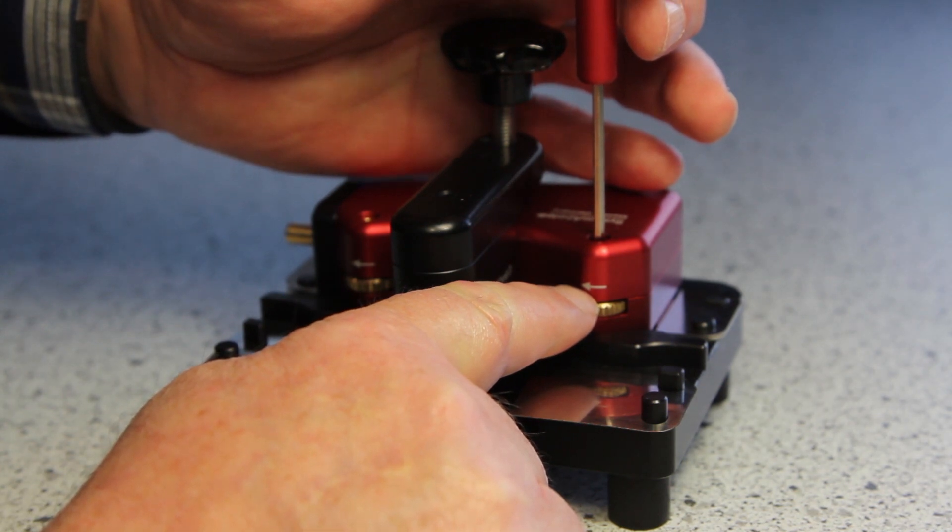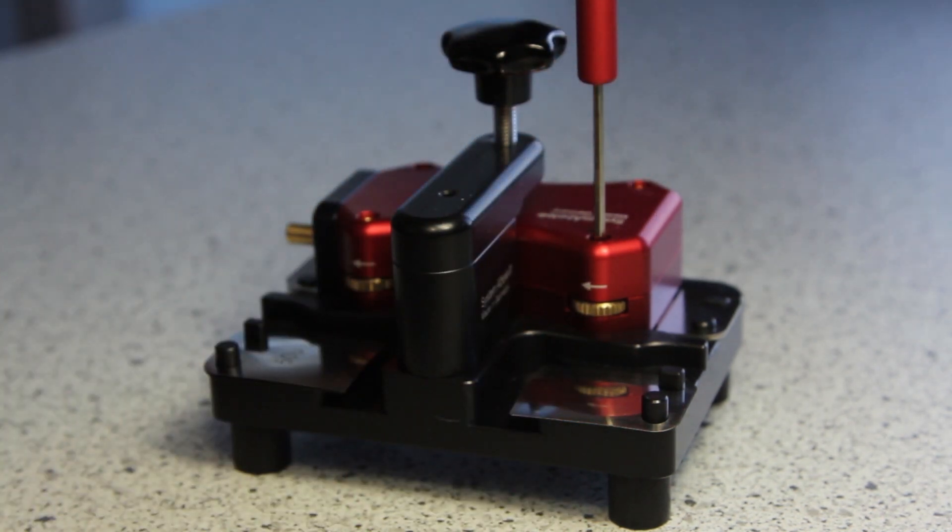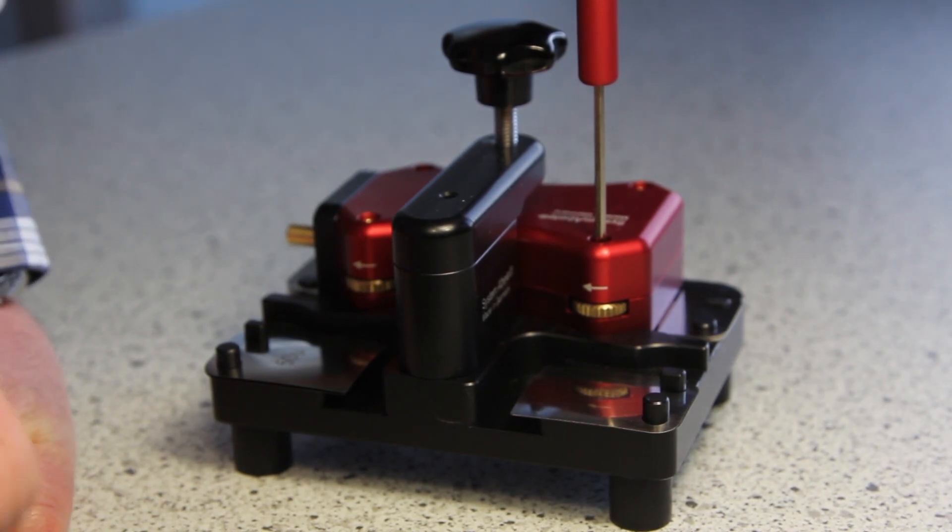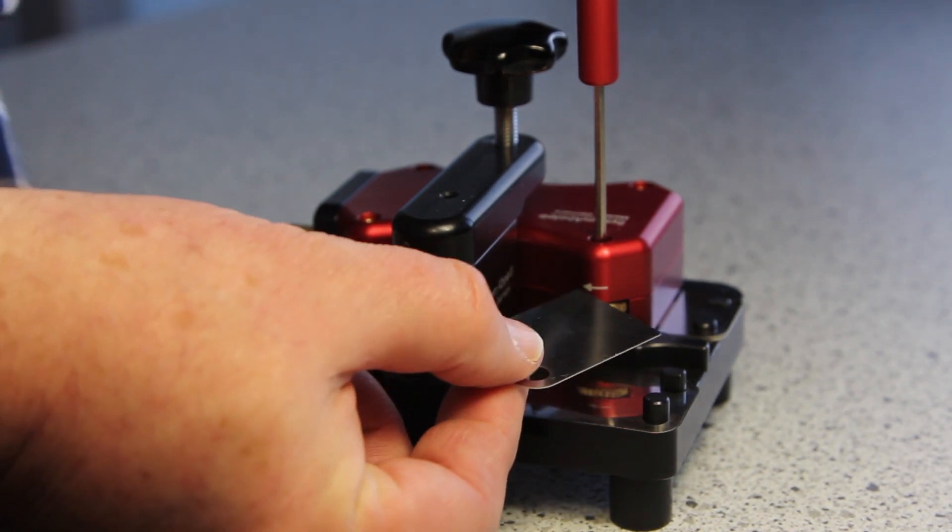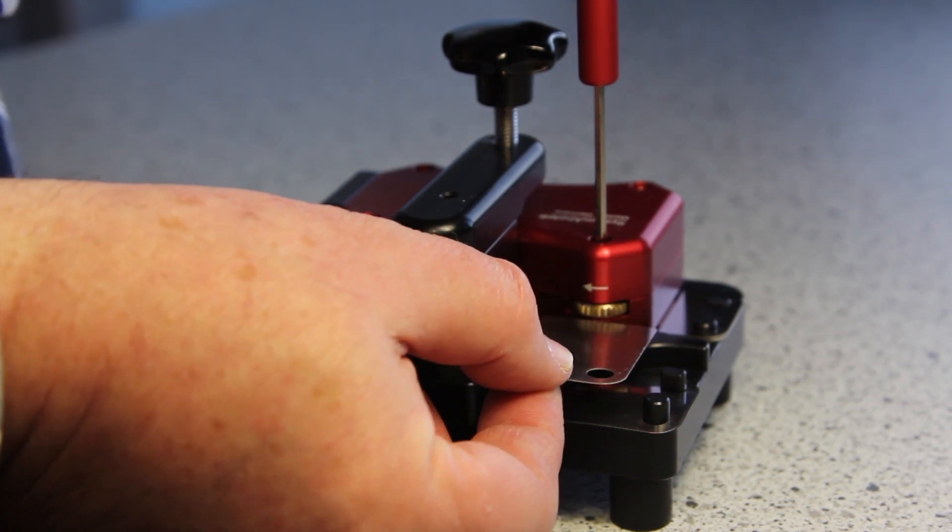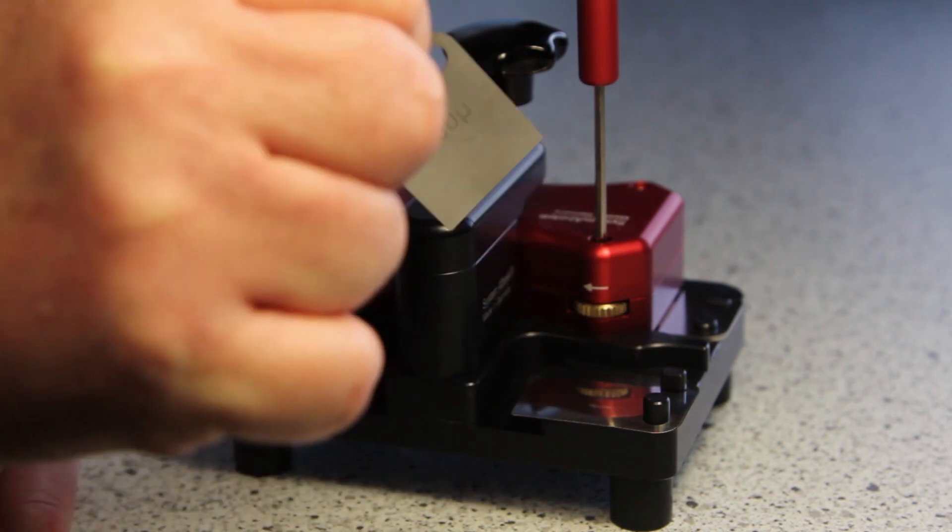It shows here. The counter nut has to be on the down side, not on the upper side. You see here fits a sheet. Here it doesn't. It's countered downwards.